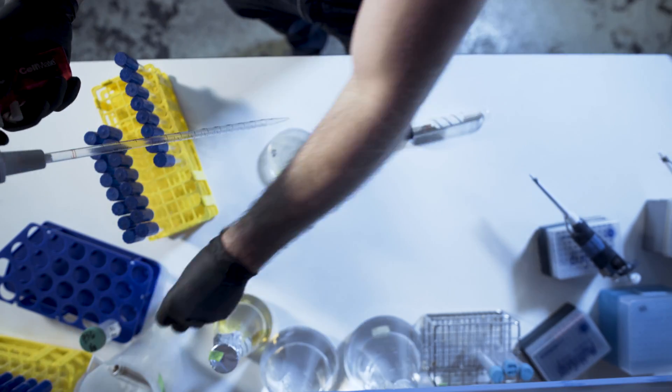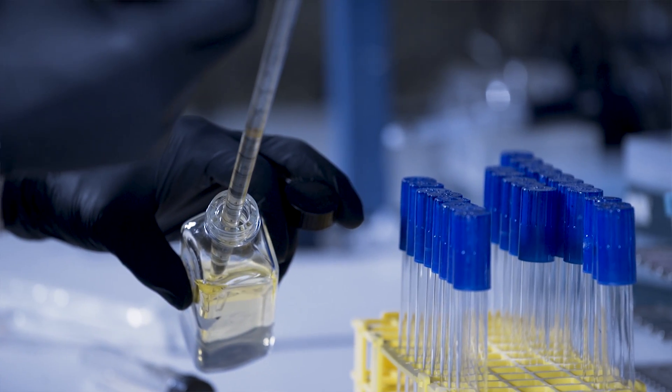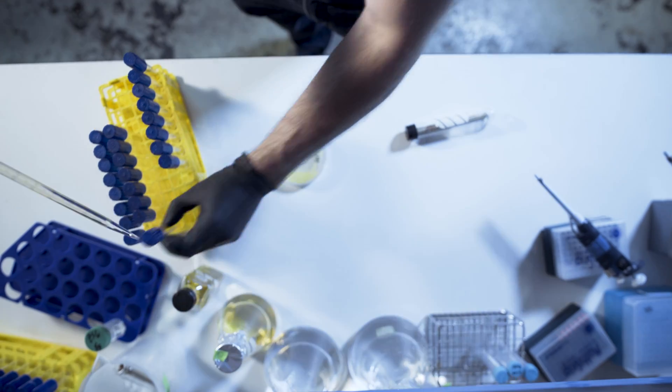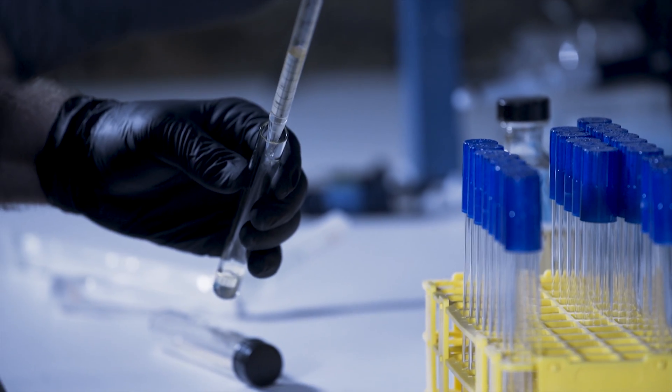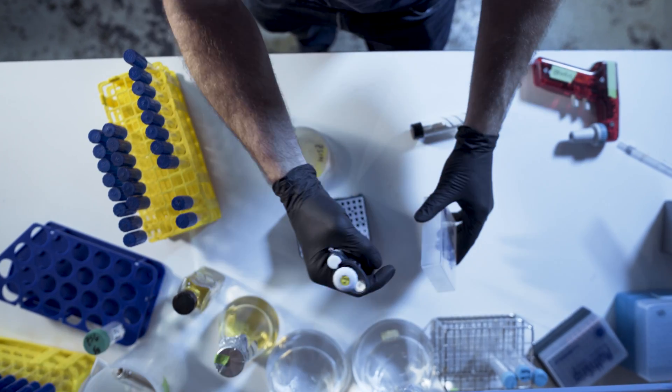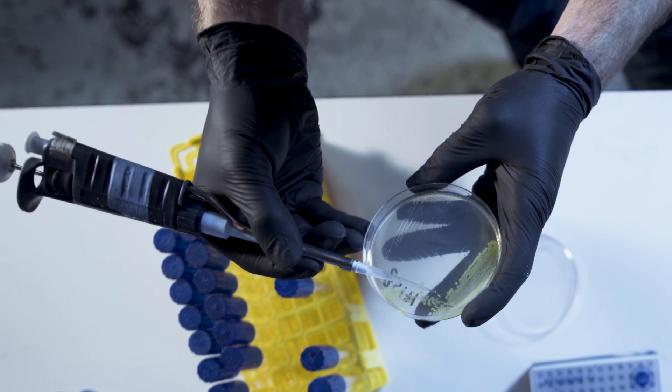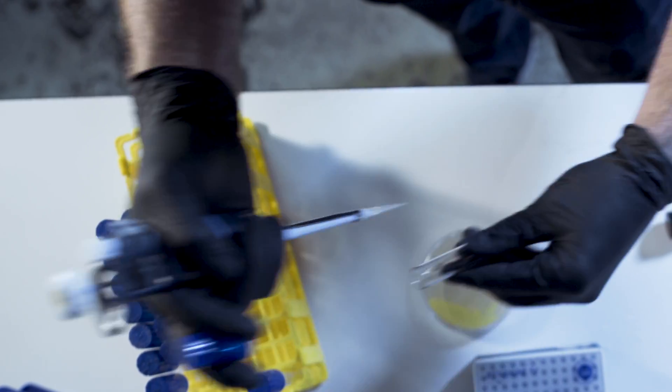Okay, now we have our new DNA. We're ready to modify our bacteria. Today, we'll use a bacteria called B. subtilis. First, prep the bacteria by growing them in a medium called Modified Competence Medium. This readies the bacteria to accept the new DNA we've designed.